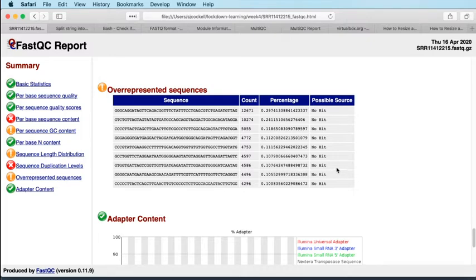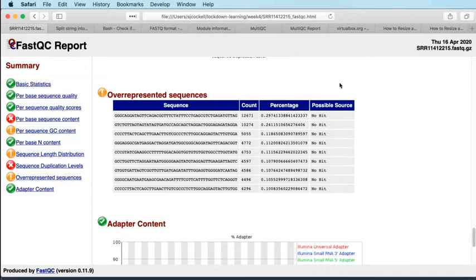But again, your knowledge of the experiment is trumping FastQC's expectations, FastQC's assumptions. And that's always the thing that I would say when looking at these reports: your knowledge of the experiment that you have done, especially if it's your experiment, is always going to trump FastQC's expectations of your data. So go into assessing these reports in a kind of knowledge-led way. Don't just look for the red crosses and assume that you want to eliminate them. What I would say for this experiment, despite the fact that we've got two crosses and a few warnings, I don't think there's any significant action that's required for this sample. I think this is a perfectly fine RNA-Seq sample that isn't showing me any cause for concern.